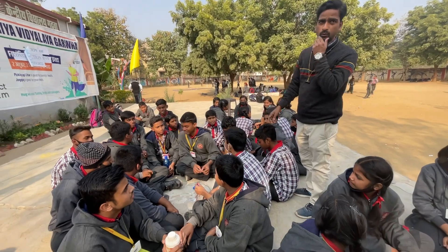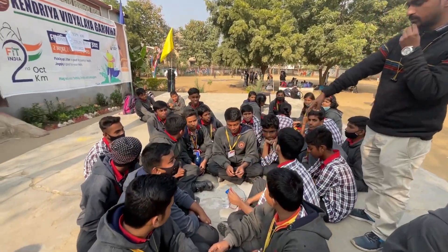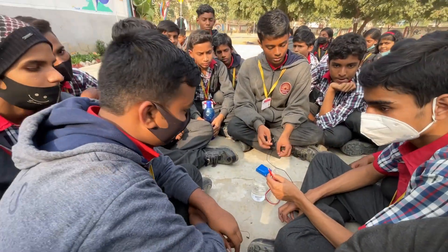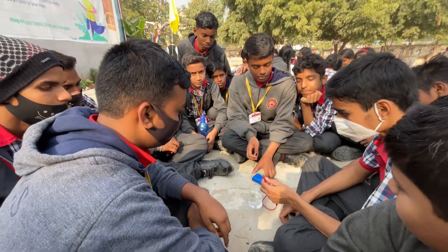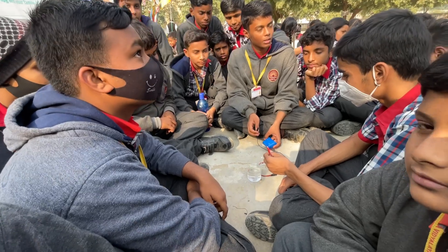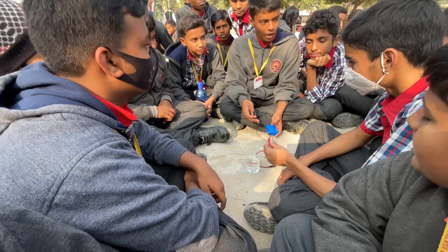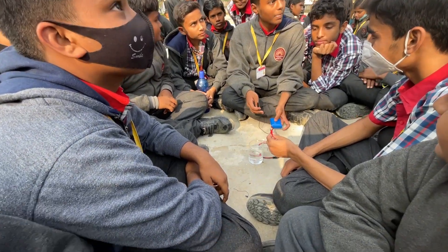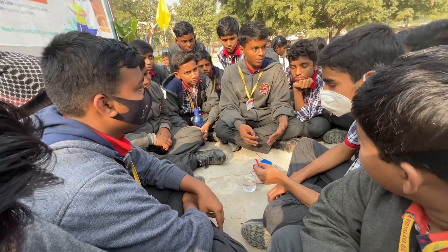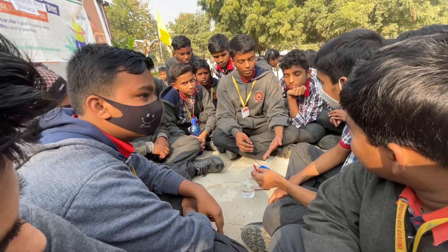First of all, we will focus on the boys group — they are conducting some kind of experiment. Let's see what they are doing. Tell me what you are doing. Sir, we are doing an activity on electrolysis in the water.